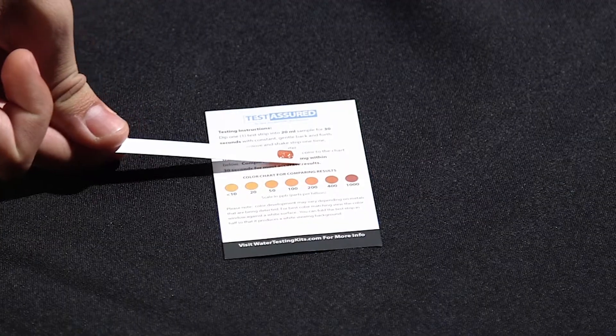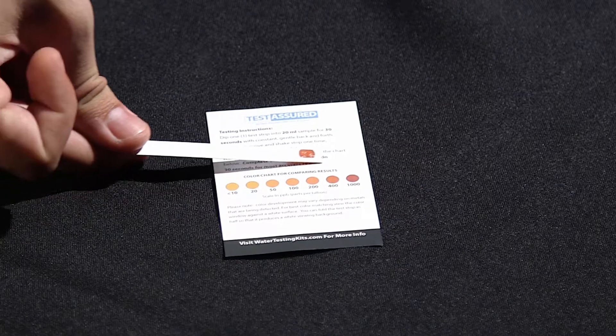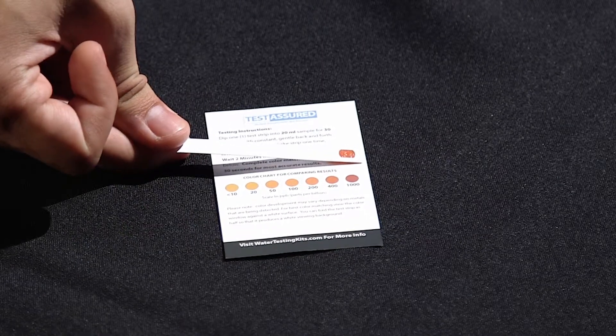After two minutes, you will see that the color has changed. Grab your test color chart and compare your test strip by holding it next to each section of the colored chart.